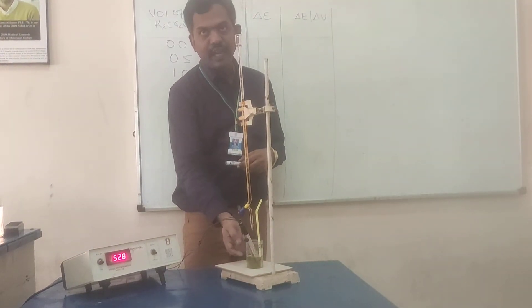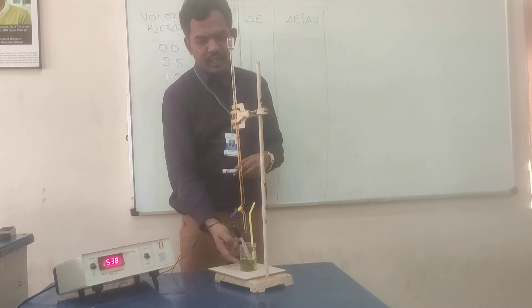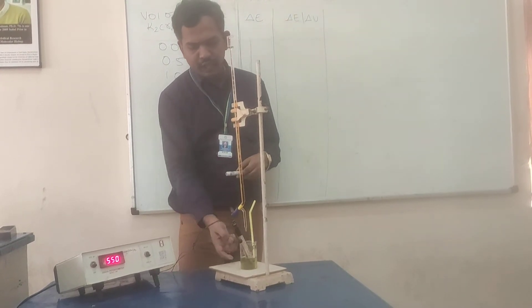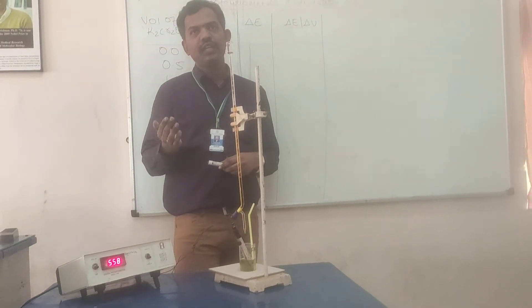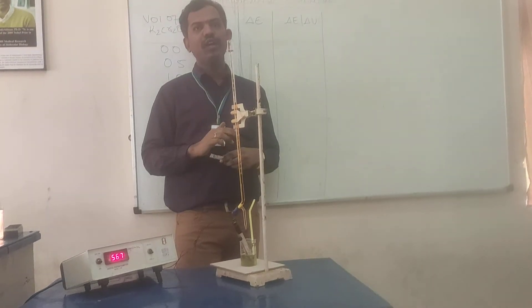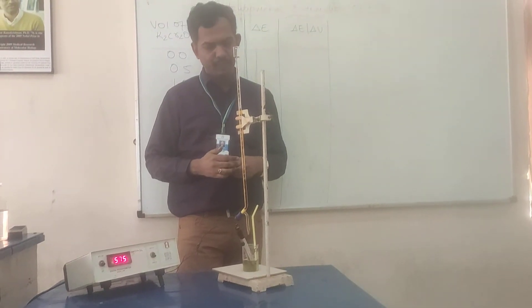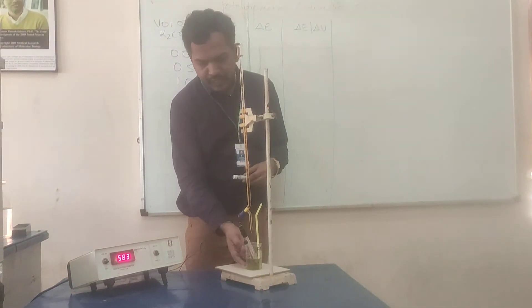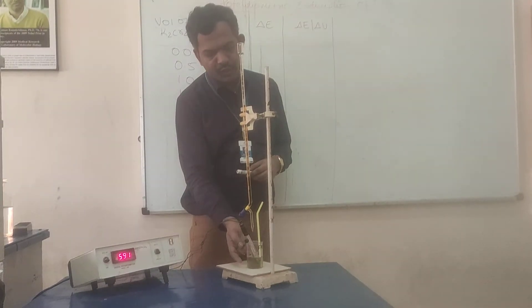We saw here, there is light blue color. Now, the color changes to greenish. So, even now, if it is not going to jump, it implies that you have done something wrong. You are supposed to redo the experiment.